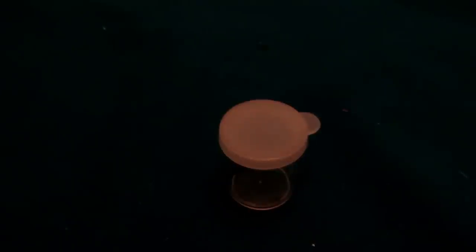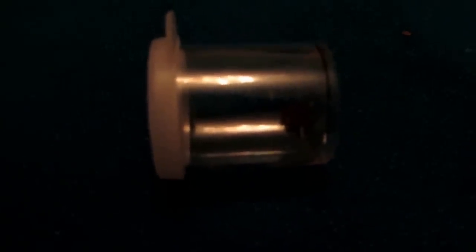Okay, so I understand how long you guys have been waiting for this palladium video, and I really do appreciate how long you have been waiting because this extraction process has taken a lot longer than I thought. But, here is our final yield of palladium powder. So, you can see it down there. Now, because this is so fine, it wouldn't make a very large bead if I was to melt it. But that is clearly palladium there. And so all I did was take the rest of those, and the stuff that was pure I kept, and the other two I really tried to get the palladium out of that, and that's what took me so long. But, I couldn't successfully do it. I still have the two solutions, and I'll probably end up saving them and try to do it in the future. But, honestly, I was having a really difficult time extracting the palladium from that for some reason. So, I just used the stuff that was the pure palladium, which is currently what I have here after I scraped off that filter.